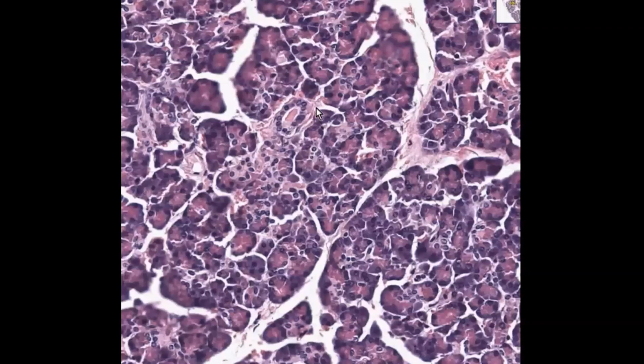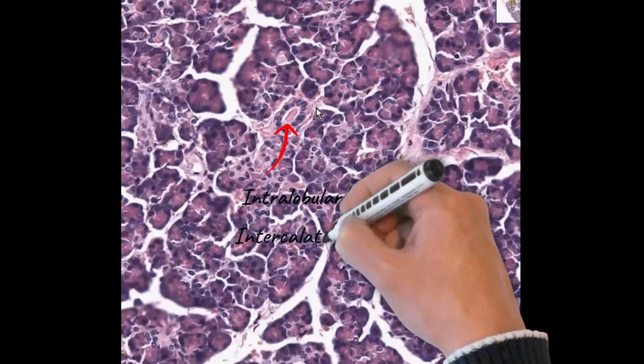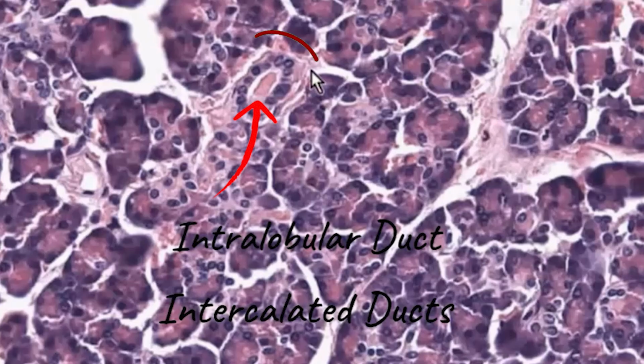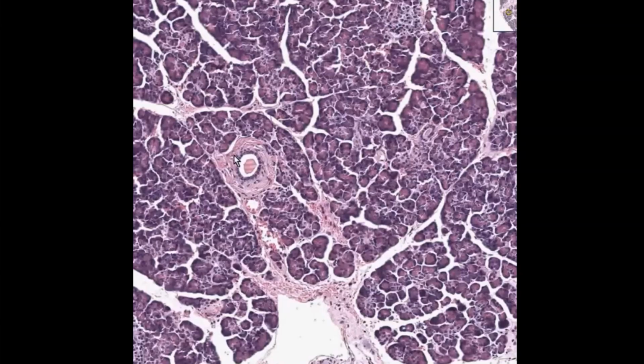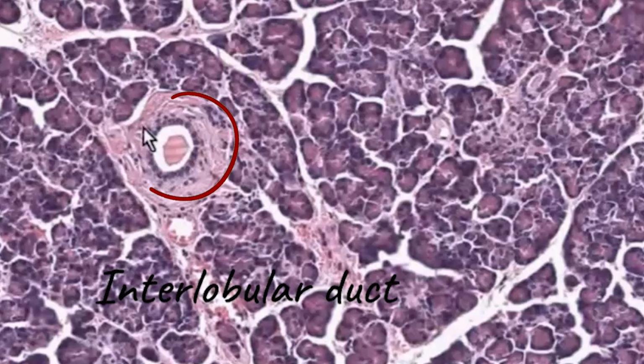Let's talk about the intralobular and interlobular ducts. Now let's identify a clear duct example here. Here is an intralobular duct, which is found within the lobules, surrounded by acini, with a thin wall made of cuboidal or columnar cells. It has minimal connective tissue around it and is often called an intercalated duct when it is very small. Let's look at an interlobular duct, which is found between lobules, and this is surrounded by connective tissue, not acini, lined by a more obvious epithelial wall, and they are larger in size.